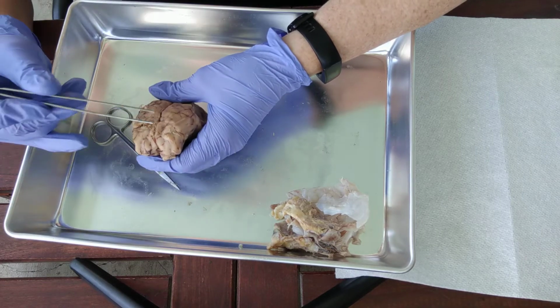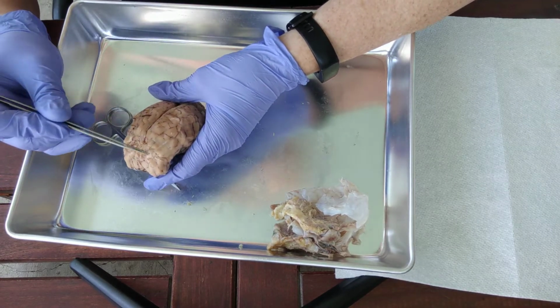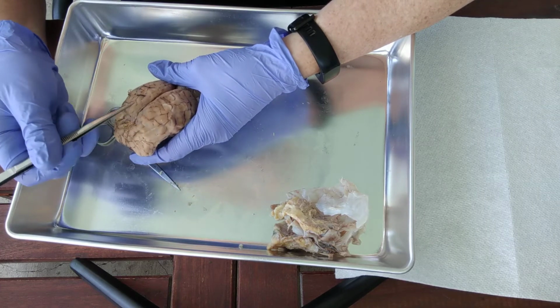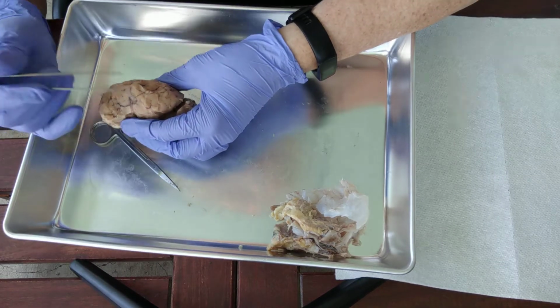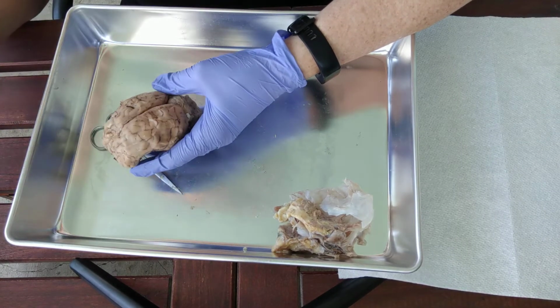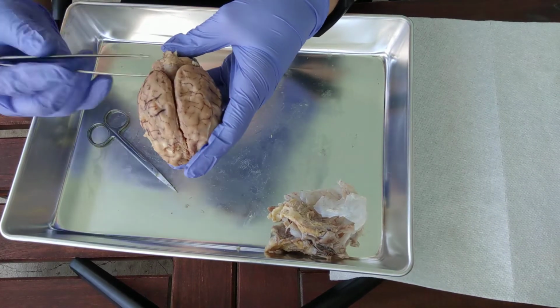Okay, so the central sulcus, and in front of the central sulcus, that would be the frontal lobe, and then behind it would be the parietal lobe. Think back to your bones, the same general idea. So frontal in the front, parietal at the top of the skull right here, and then this area here, where your ears or temples would be, that would be the temporal lobe down in there. And then this area in the very back, that would be the occipital lobe.